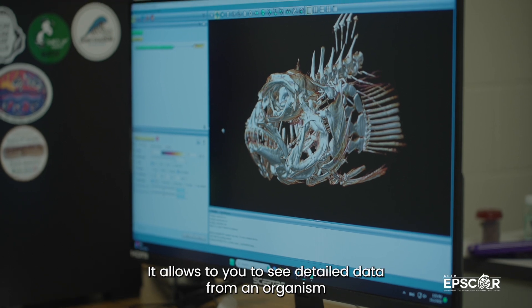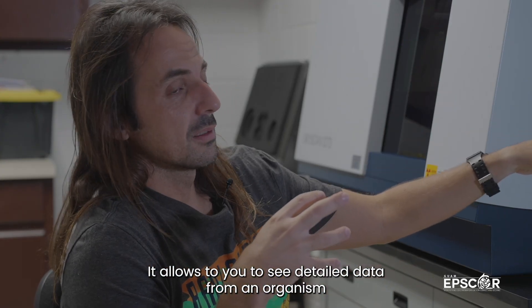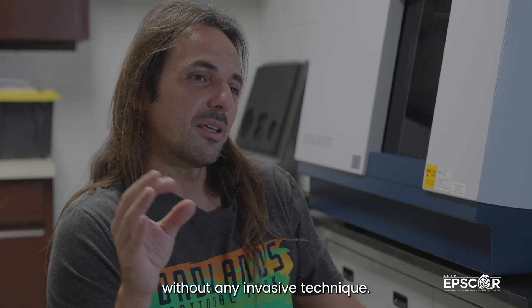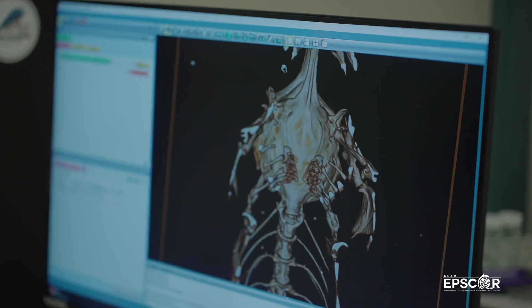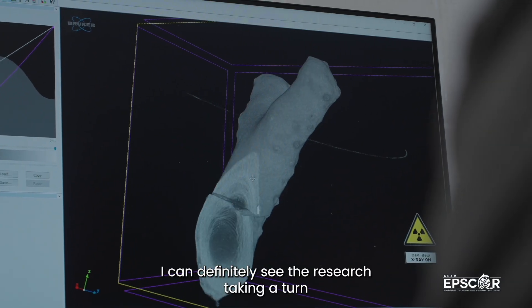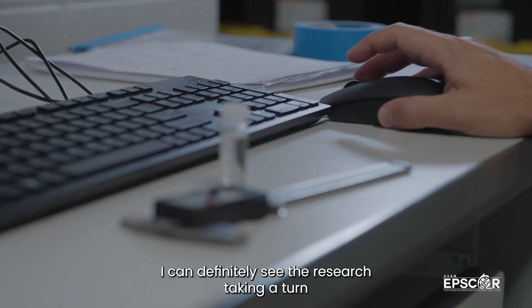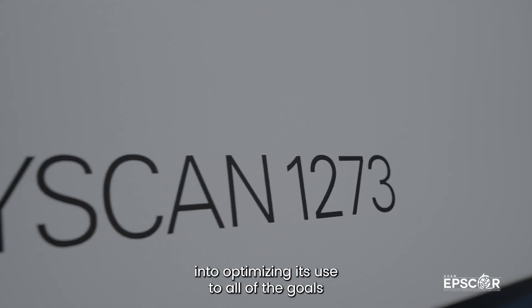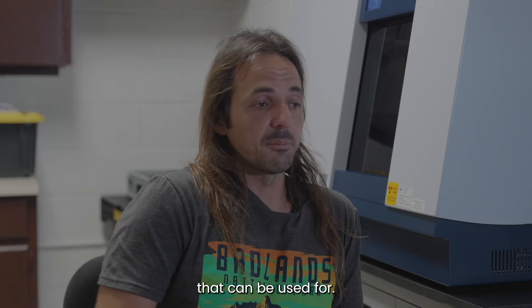It allows you to see detailed data from an organism without any invasive technique. I can definitely see the research taking a turn into optimizing its use to all the goals that can be used.